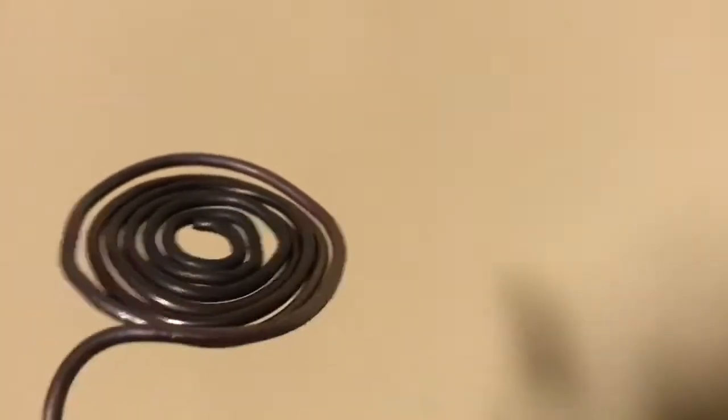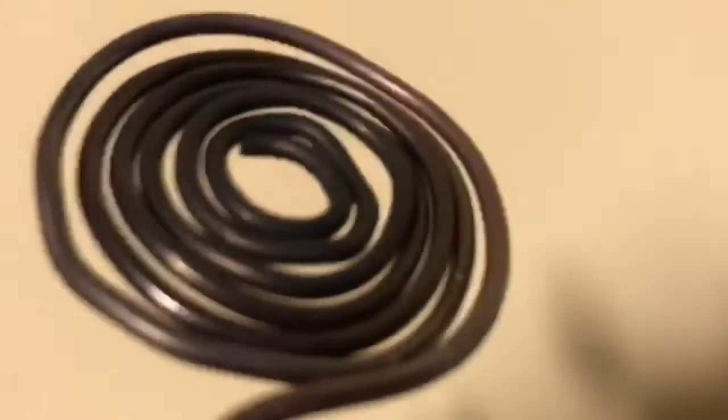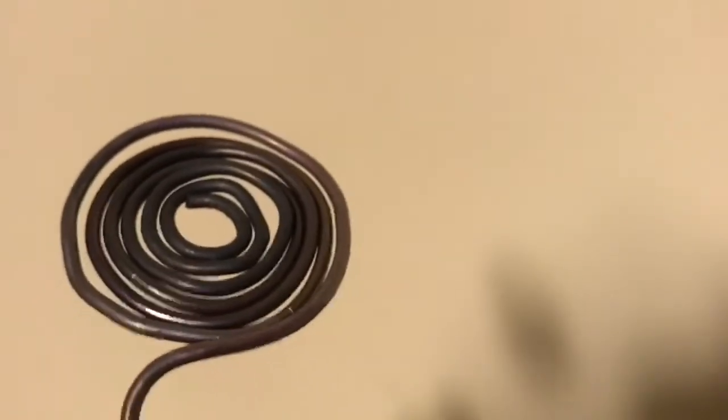In this video I'm going to use this copper coil to catalyze the decomposition of isopropanol or rubbing alcohol, followed by acetone, and show you how these two solvents behave with heated copper.